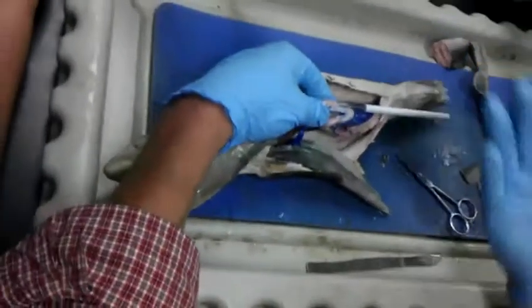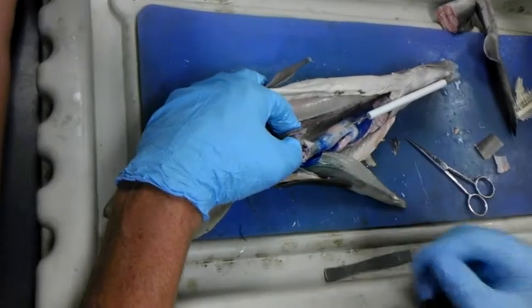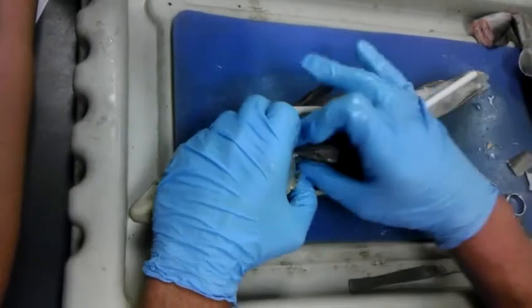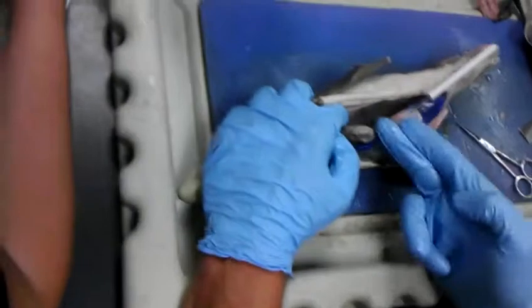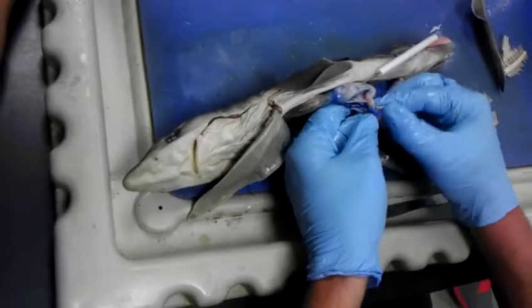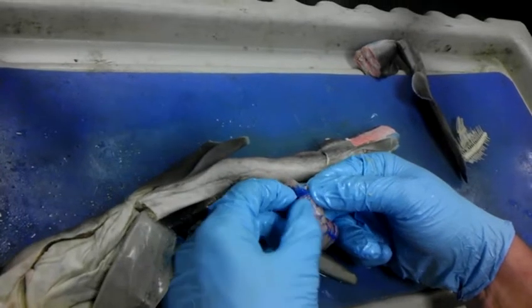So be as specific as you can. And if you don't know, then ask Jenny or me, saying, are you pinning this? Is it the stomach or do you want the pylorus portion of the stomach? We'll tell you which one. But always be as specific as you can. Does just the cardiac region have the rugae? No. Rugae are throughout. Cardiac is the upper, pylorus is the lower. There's no really distinct area where I can say, right here's the dividing line. That doesn't happen. When does the stomach end? It's right here at the pyloric sphincter muscle. And so you see how this is kind of flaccid? This is the small intestine here.